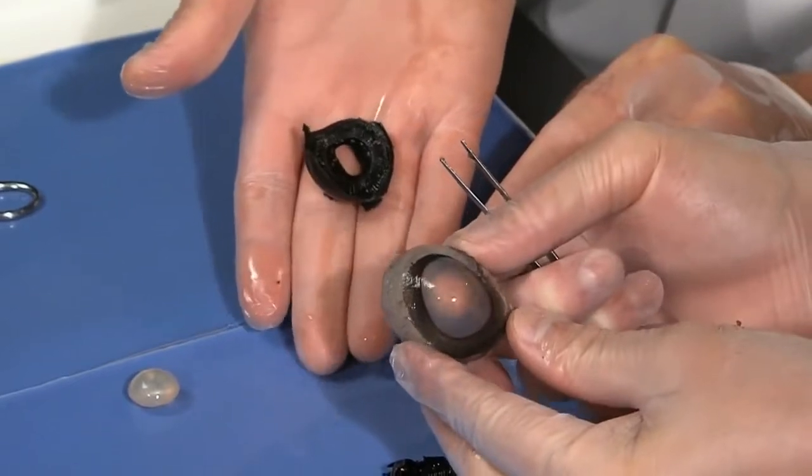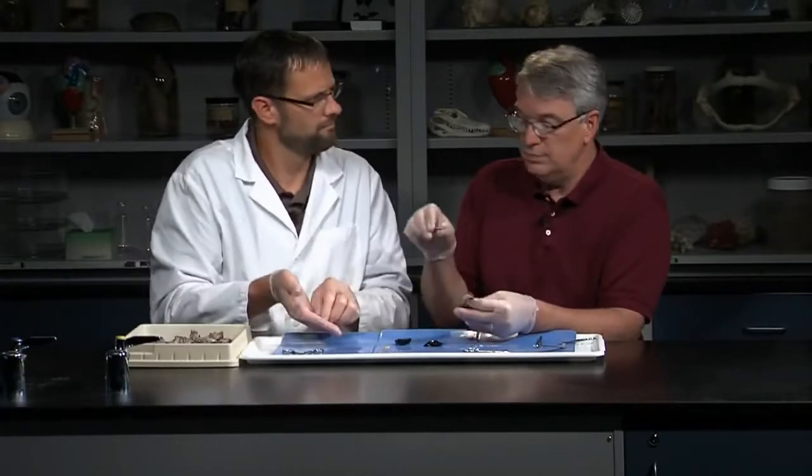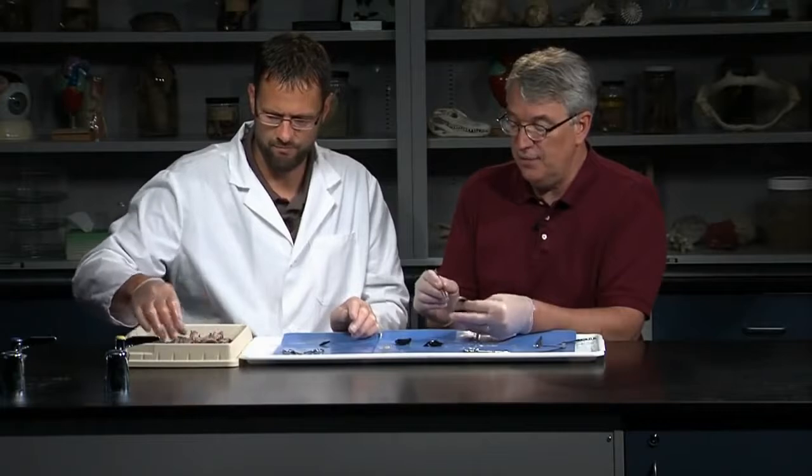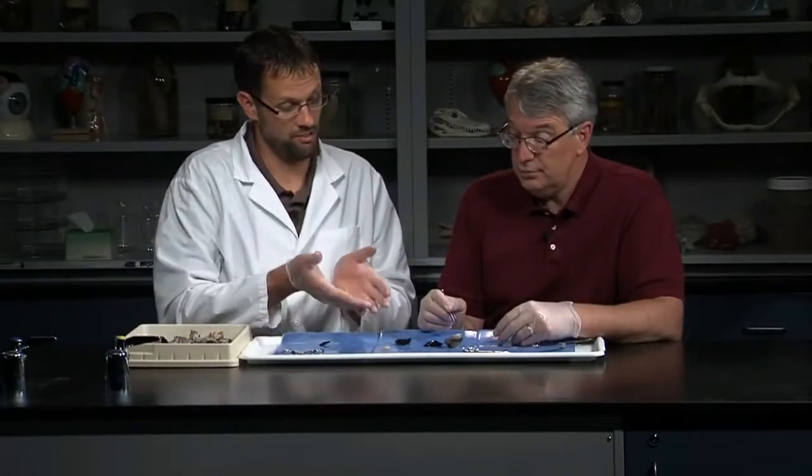You can see how transparent that cornea is — you can see my finger through it. So light enters, passes through the cornea, through the opening — the pupil — and through the lens. The lens then focuses the light on the retina, and those signals are sent to the brain and interpreted as vision. Not really complicated, but it works fantastically. The level of visual acuity that most vertebrates, in particular mammals, have is amazing, and we depend greatly on our visual senses.